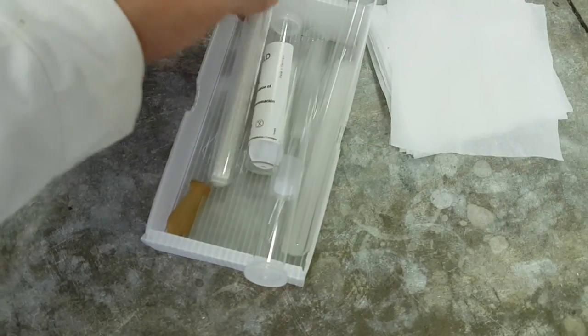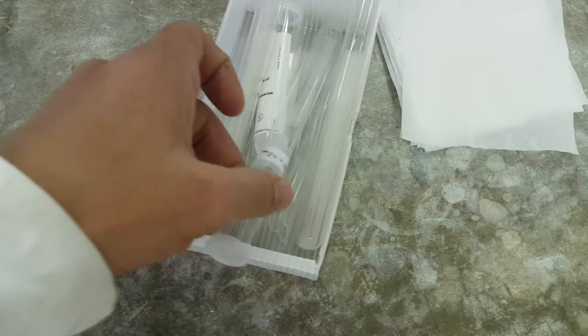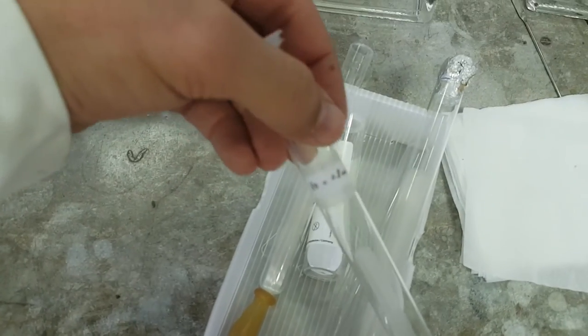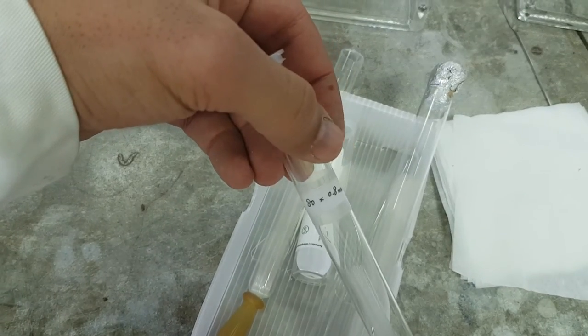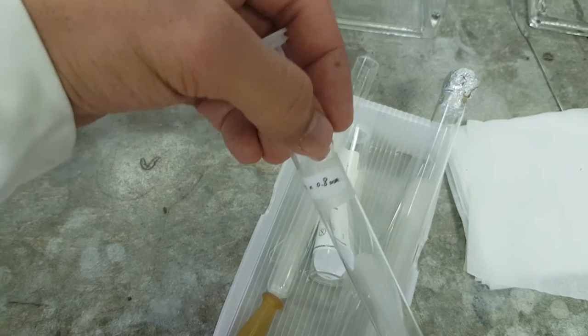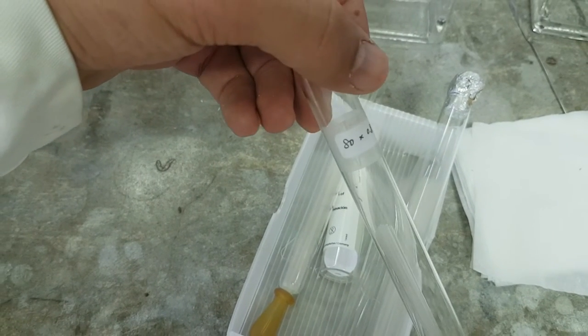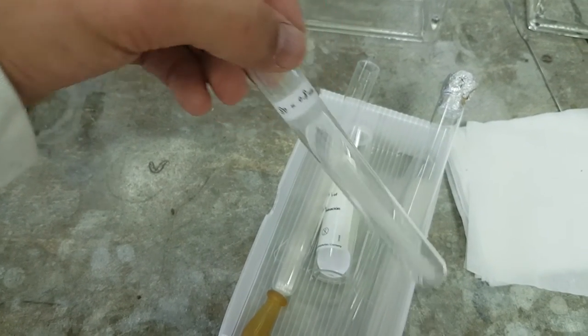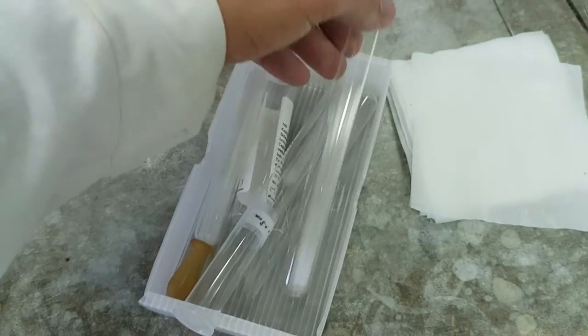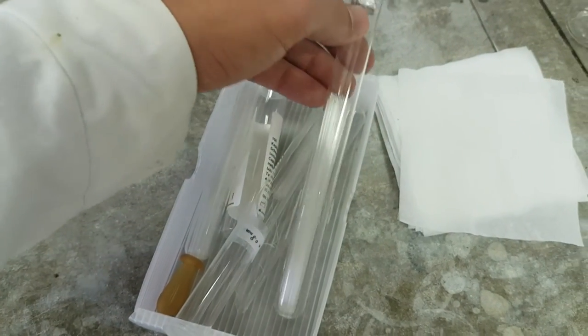For example, you have different capillary tubes, but usually we use a width of 0.8 millimeter. This is the width of the capillary tube. In fact, you have different widths.